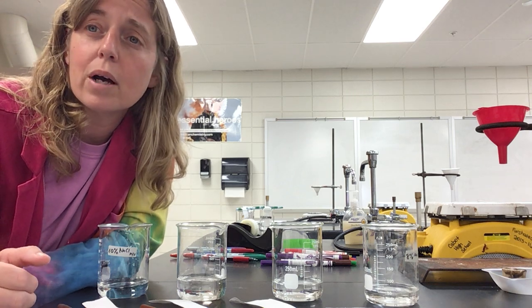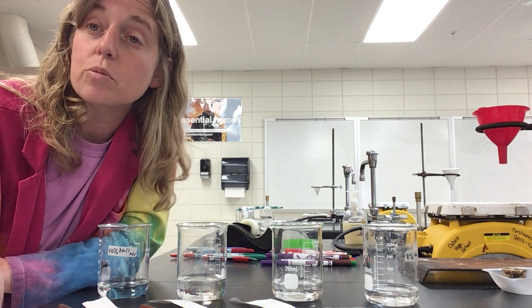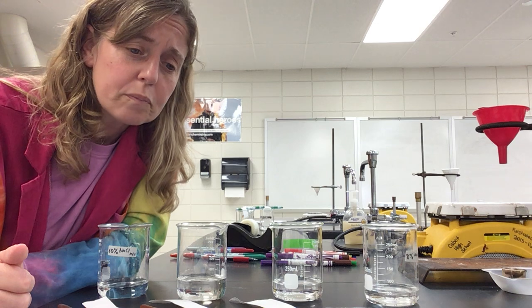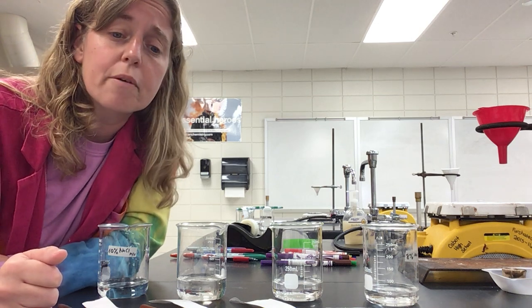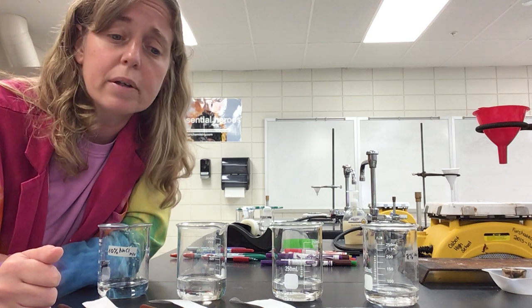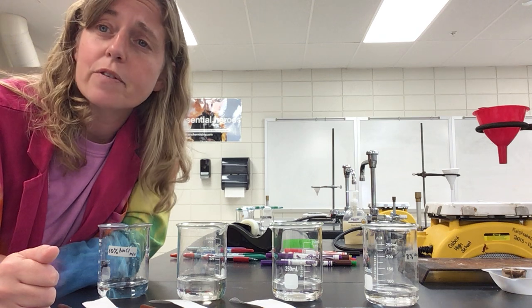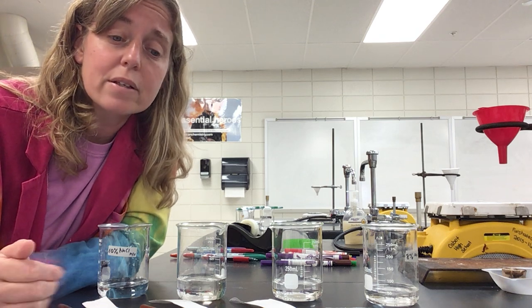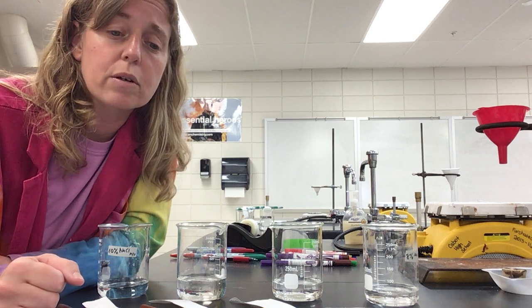They can also, when someone writes a note, see what kind of pen they used on there. So here's how it works. Because molecules in ink and other mixtures have different characteristics such as size, charge, and solubility, they travel at different speeds when pulled along a piece of paper by a solvent. In this case, we'll use water. If you're using a Sharpie, isopropyl alcohol would be your solvent.